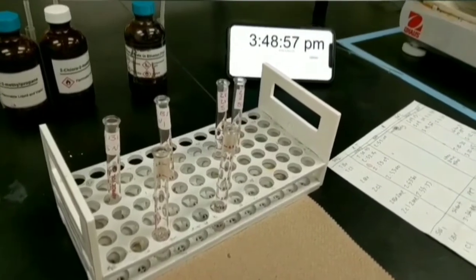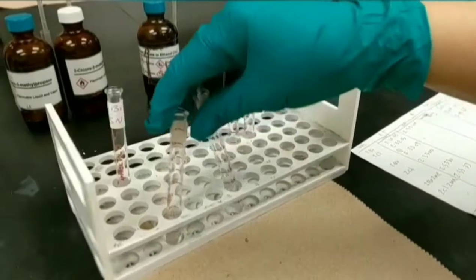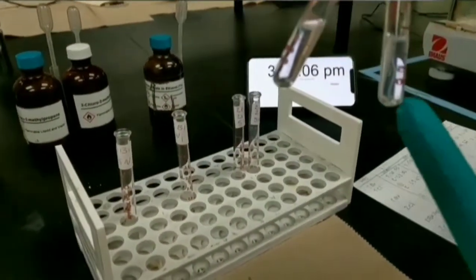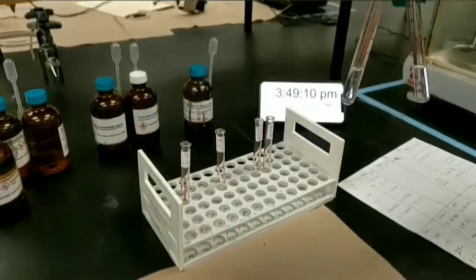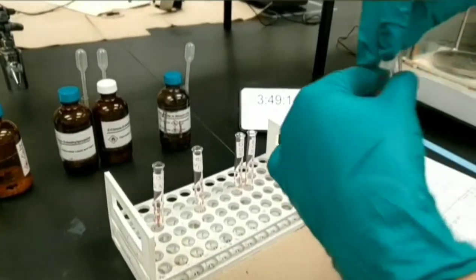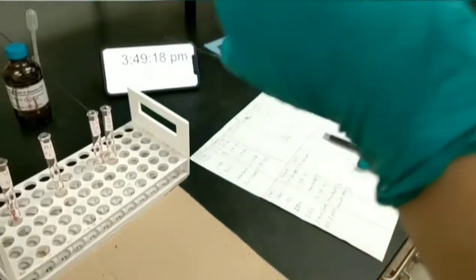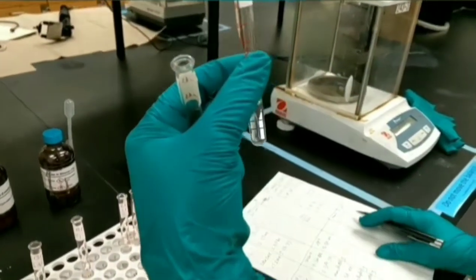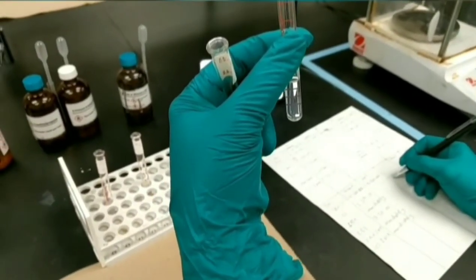I'm back after 15 minutes. The first test tube is 1-chlorobutane and the second one is 2-chlorobutane. The second one is cloudy, so you need to record the time for the ending time of reaction. There is no precipitation for 1-chloro, so we need to put it in the water bath. We recorded the ending time for 2-chlorobutane, but I still want to keep it in water bath in order to see a better cloudy solution or maybe any precipitation.